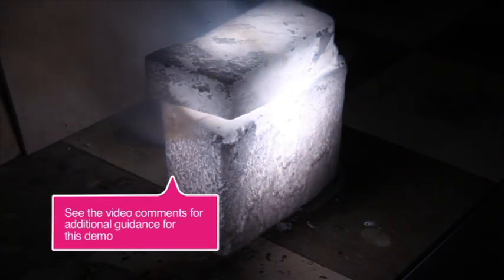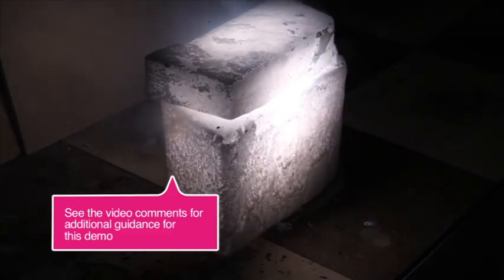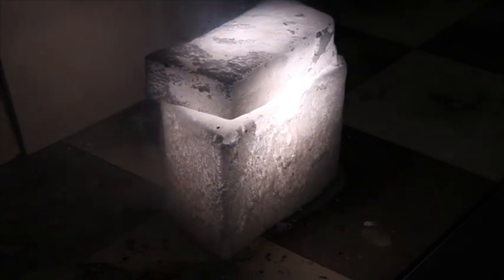This experiment is being performed in a fume cupboard because of restrictions where we filmed it. At school it can be done in the open lab with a safety screen to protect the audience, who should be 2-3 meters away, and another screen to protect yourself. The use of a blowtorch was for convenience, but Bunsen will do just as well.